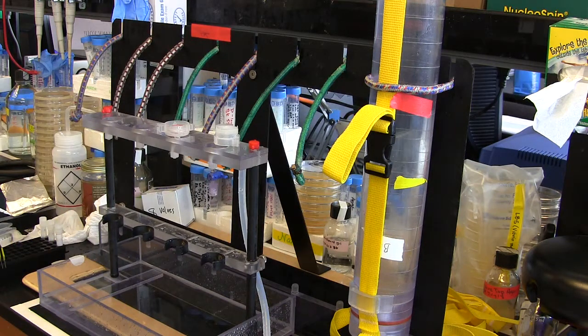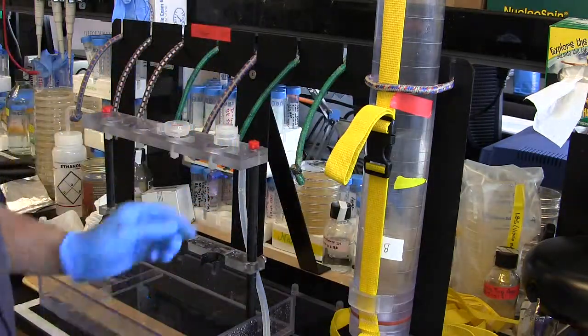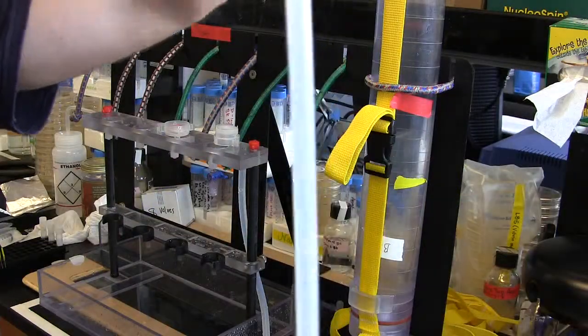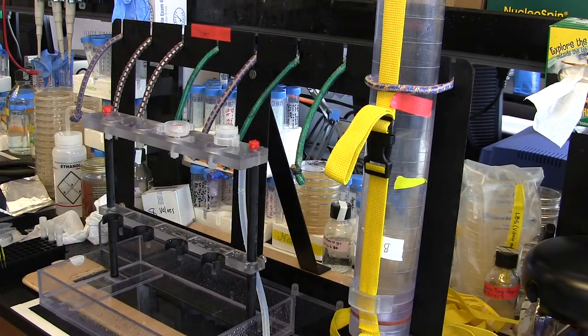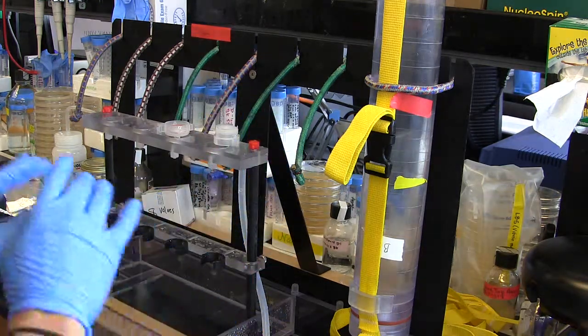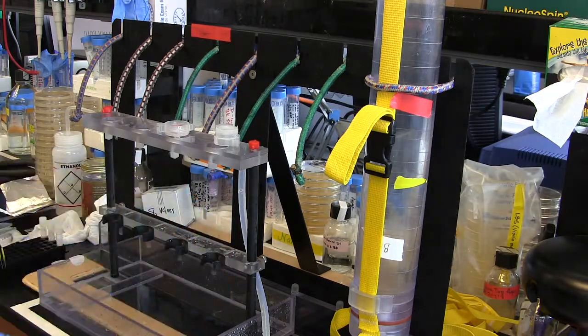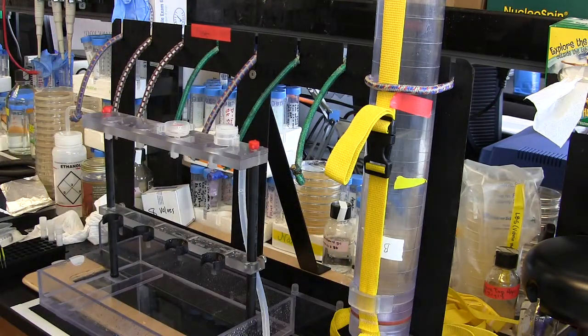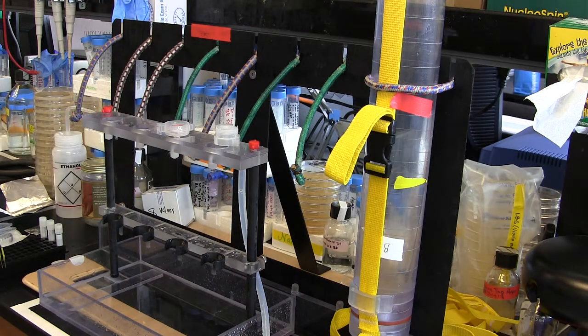The last thing: when the Niskin has run out of water, disassemble everything and take your hoses — hold one end and flick them like a whip so all the liquid comes flying out the end, and store those dry. Usually we leave the water chemistry set set up overnight for the length of a cruise and just put the Niskins on as you need. The very last thing is to turn off the air tank, otherwise you'll just drain it overnight. That's all off now — everybody's happy.